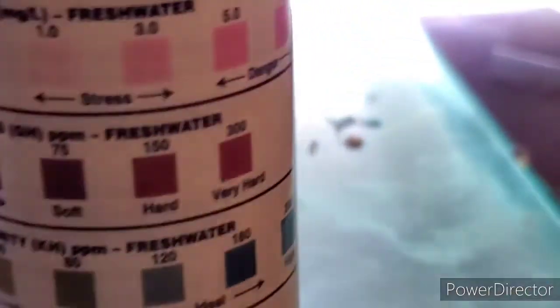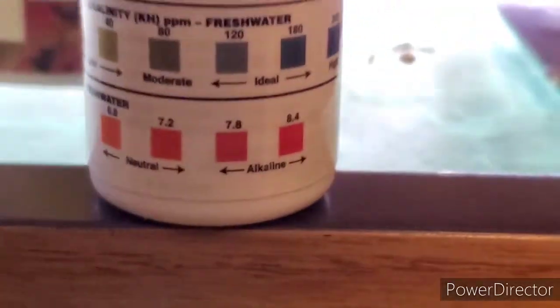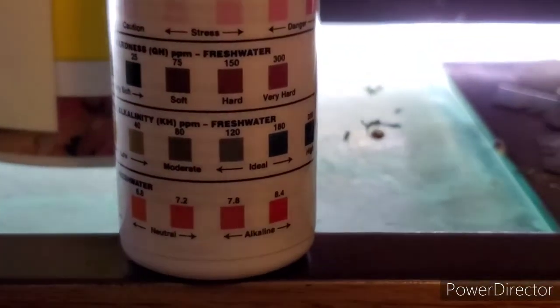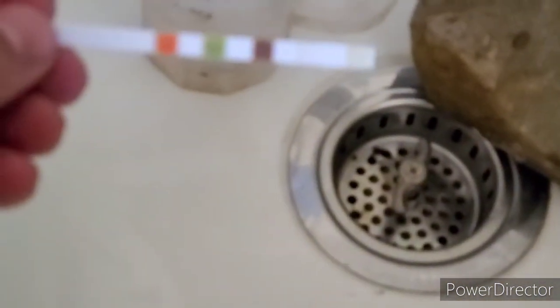Now, I'm going to take another strip, and I'm going to test my tap water. Alright, so now I've got this dirty aquarium cup, I'll stick my test in, pull it out, let it sit for a little bit.